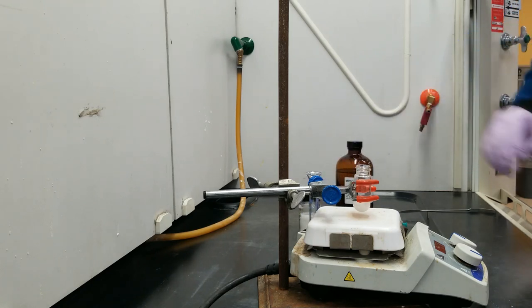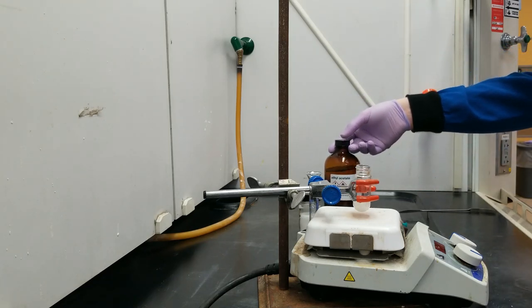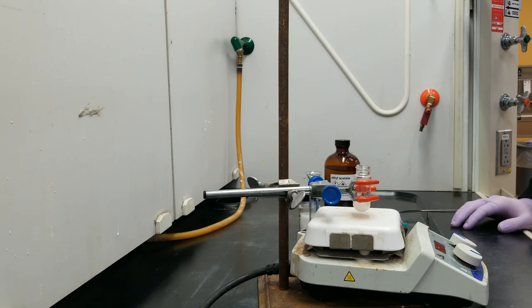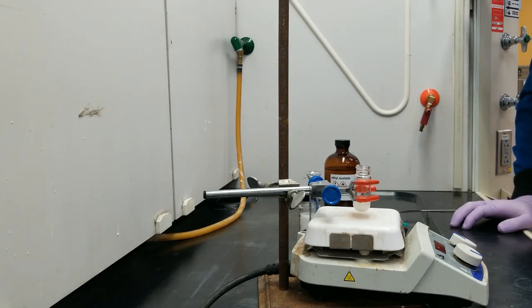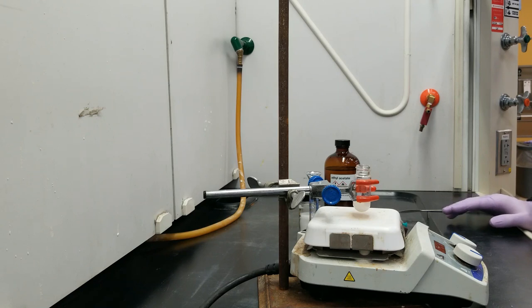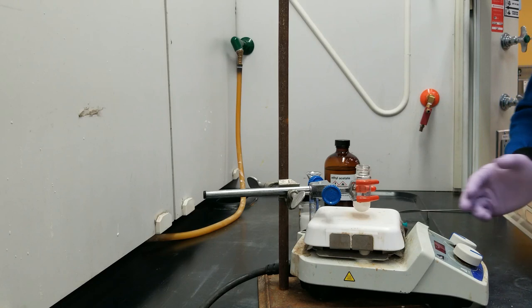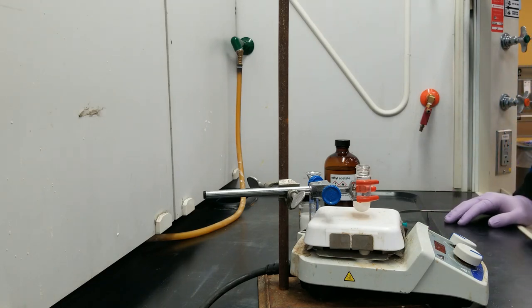The first is that since we are mixing ethyl acetate and water, this is a biphasic system. It has a water layer and it has an ethyl acetate layer. Those do not mix together. What that means is, again, not to nag you about it, but you need to have really good stirring in order to let the compounds in those two layers mix together well. This reaction could be called a rather environmentally friendly or green reaction as well. There's a few reasons for that. First off, please note that we are only stirring this. This is not on heat at all. So any carbon footprint associated with heating the reaction does not apply.